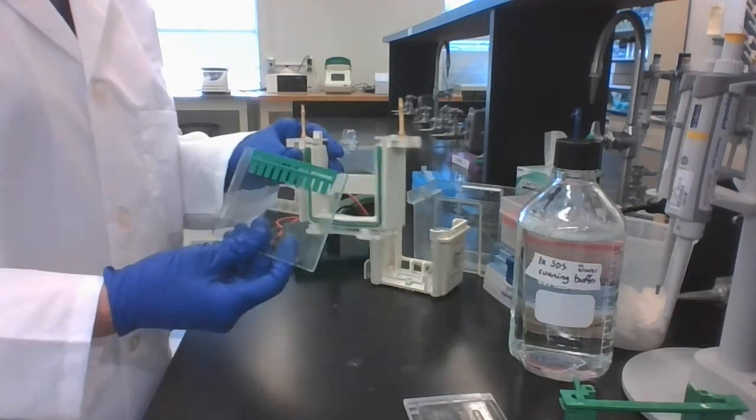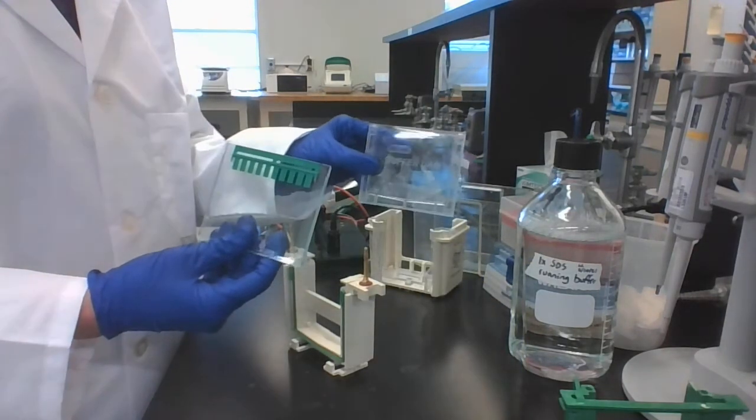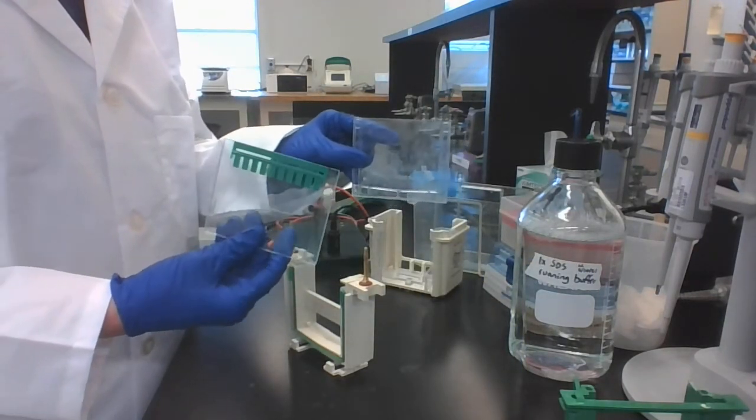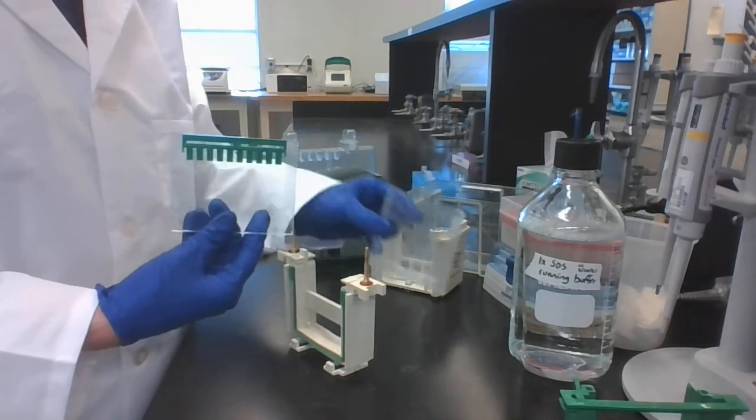Next, you want to get your plate holder. If you're only running one gel, you need to have a buffer dam. If you're running two gels, they will go together in the same holder, but you actually need two things in order to hold the buffer in the middle.